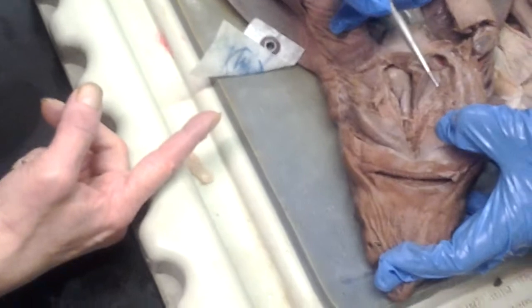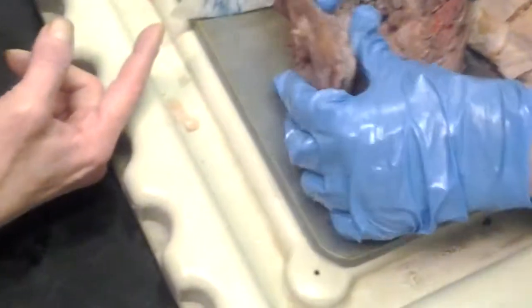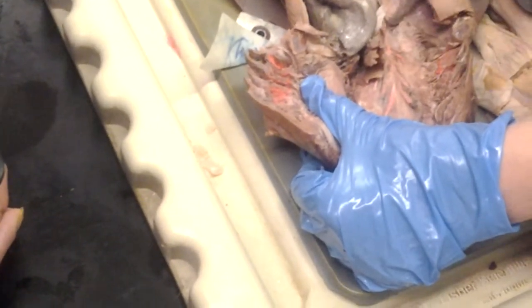What about the afferent? Deoxygenated or oxygenated? Deoxygenated. Afferent is deoxygenated, and efferent is oxygenated, because the gills provide the oxygen. Those are the afferent. Afferent, with an A. This is afferent, and these are the efferent. Afferent is ventral. Efferent is dorsal. Afferent has deoxygenated blood, efferent has oxygenated blood, so oxygen is carried in here back to the body.